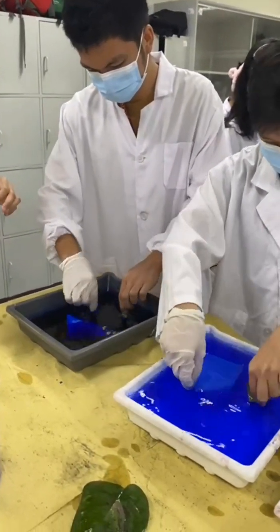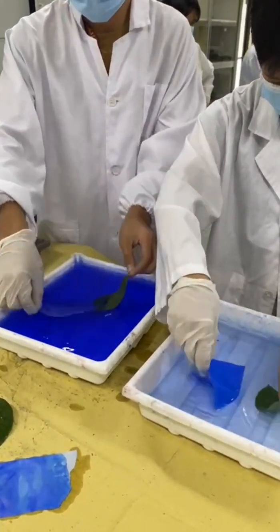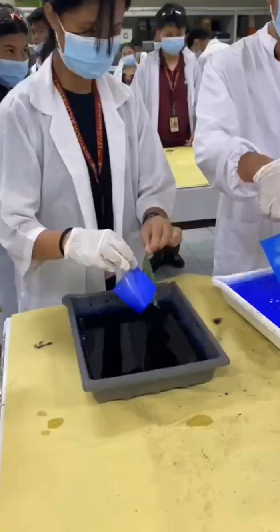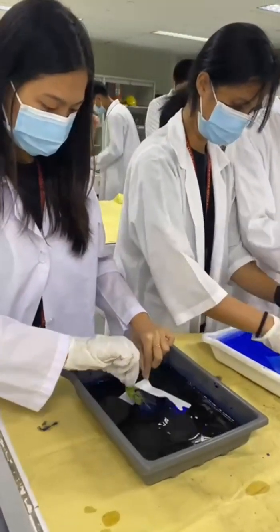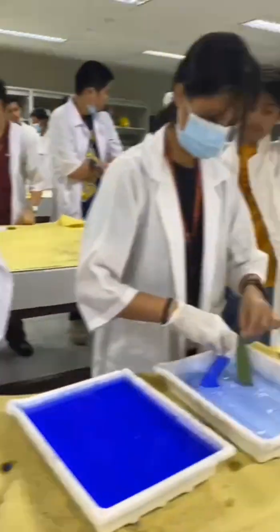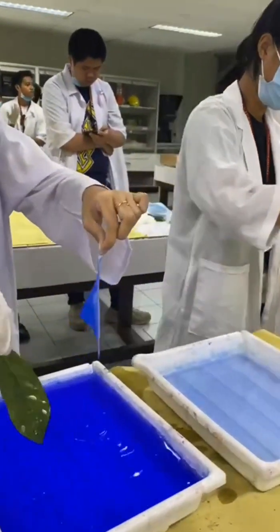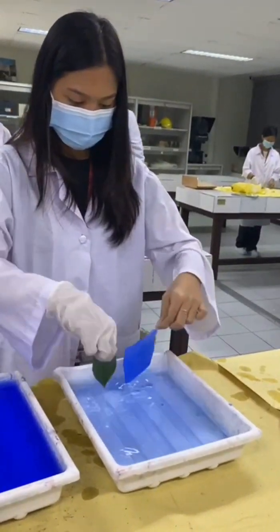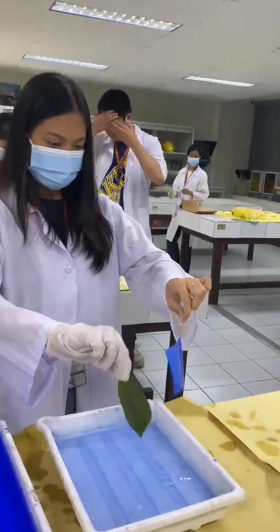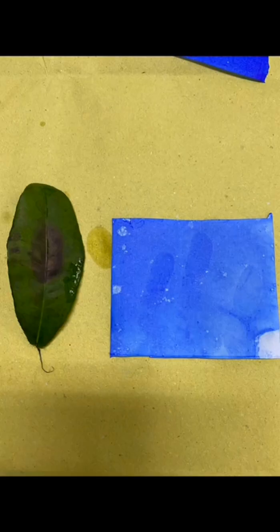This chemical binds to fatty and oily components in the fingerprint residue. After allowing sufficient time for the dye to react, the surface is gently rinsed and dried. The developed fingerprints begin to emerge as a vivid blue pattern, revealing rich details with excellent contrast against the background. The dye's interaction with the fingerprint residue resulted in a high-quality print, characterized by well-defined fingerprint ridge characteristics. Overall, the Victoria Blue method proves to be an effective and straightforward technique for developing latent fingerprints, making it an essential asset in forensic science for fingerprint analysis.